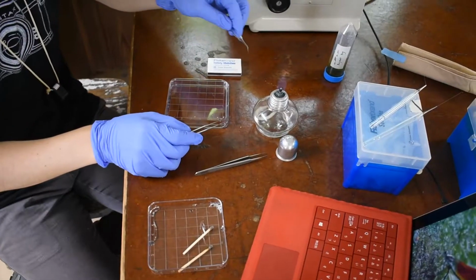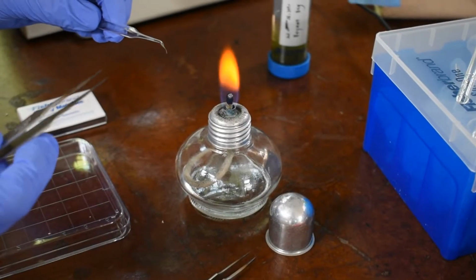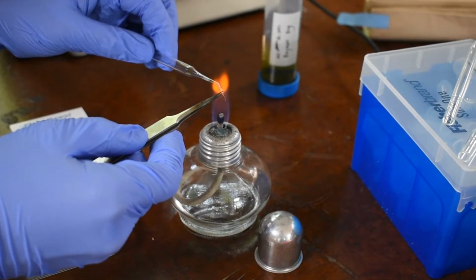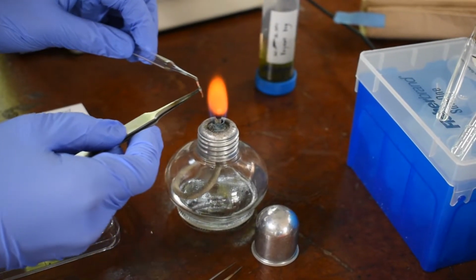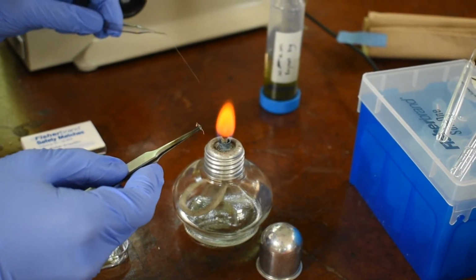Once a chytrid of interest has been spotted, single infected hosts can be isolated with a glass microcapillary mouth pipette. Dr. Cito takes a sterile glass pipette and holds the end over a flame. After a few seconds, the glass is hot enough to be stretched. With one quick, precise movement, the glass is pulled into a long capillary and the end trimmed in the fire.